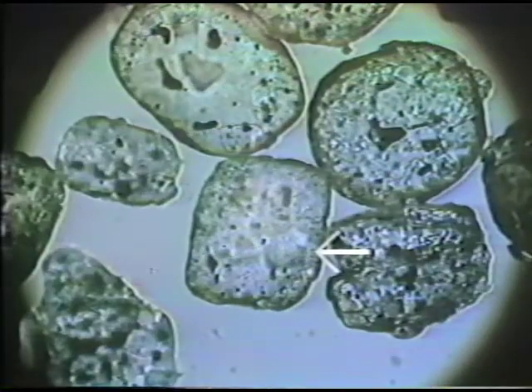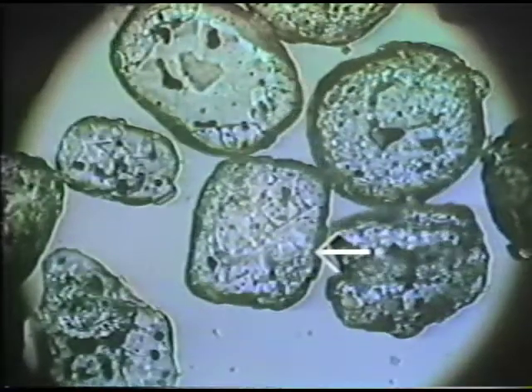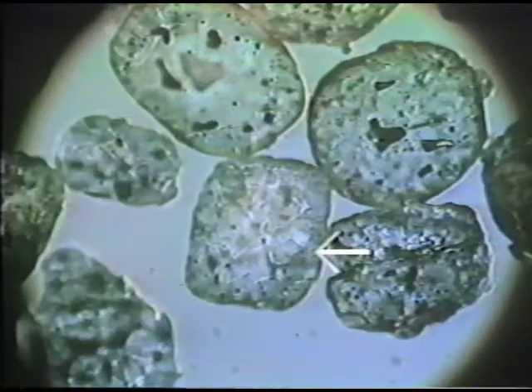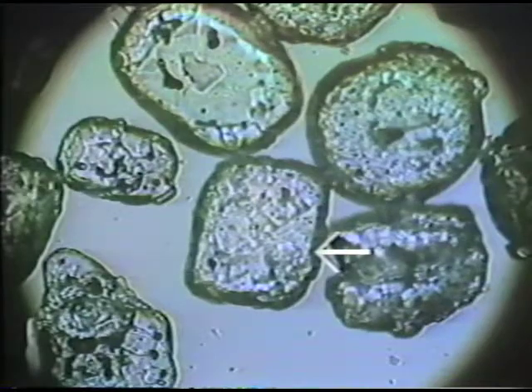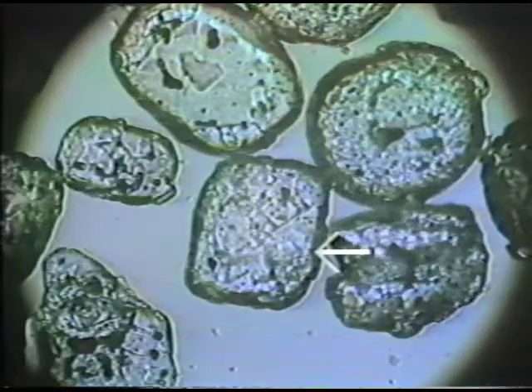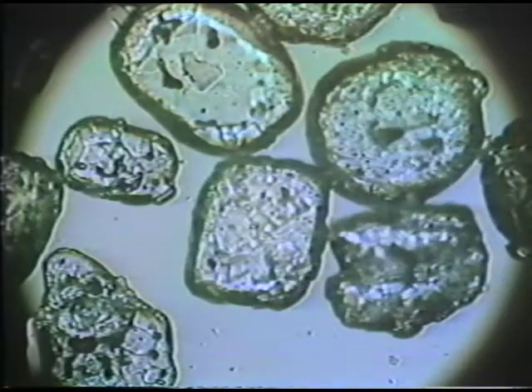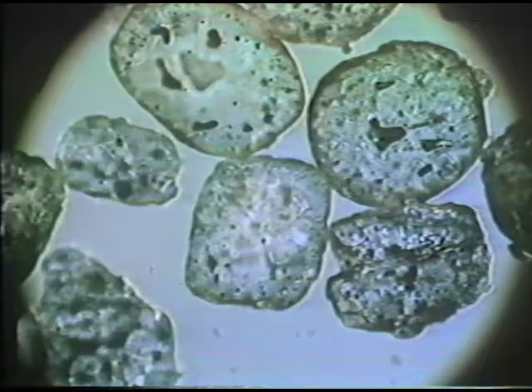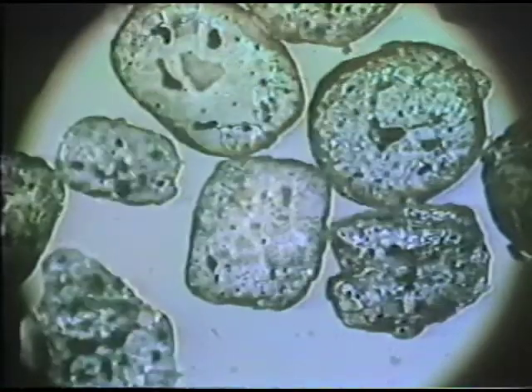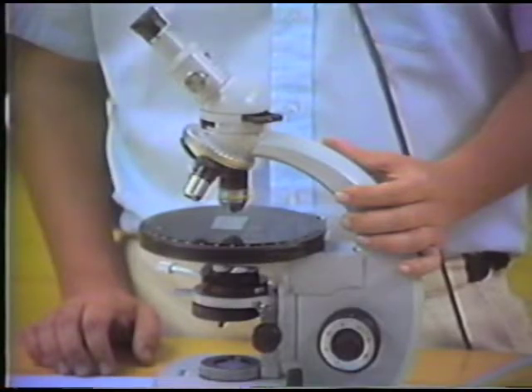this particular line moves out of the crystal. You can see that the line is moving out of the crystal as I raise the plane of focus of the stage. And this is the Becke line, the central illumination test. And when this line moves out, when I make this sense of movement, and I raise the focus and the line is moving out, this tells me that the crystal has a refractive index that is lower than the refractive index of the mounting medium.